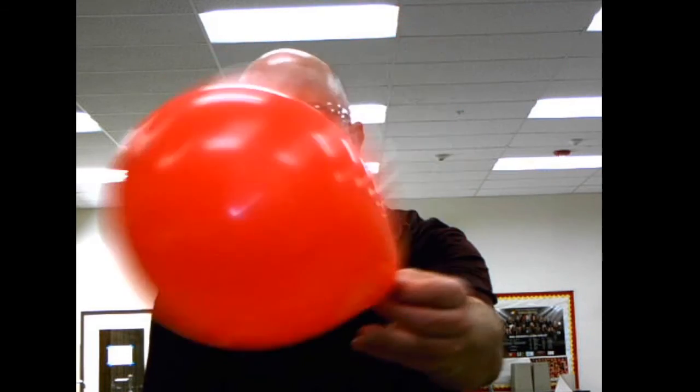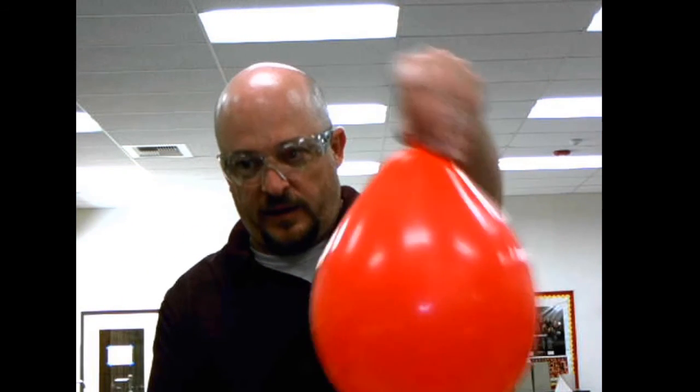All right, I'm guessing you guys came up with some ideas. First off, the red balloon, the regular old balloon, just has air inside of it. There's nothing other than the latex and air inside. And when you put a flame to it, whammo, the balloon goes away.